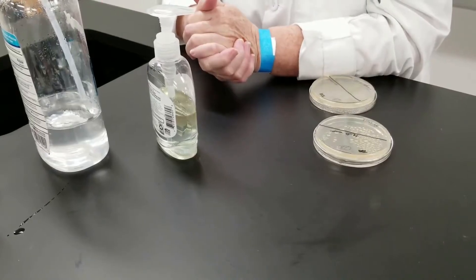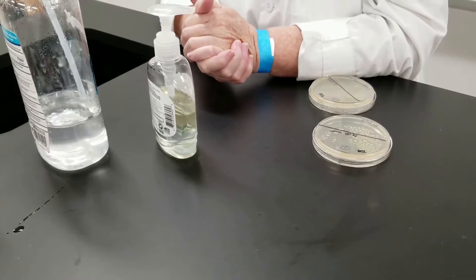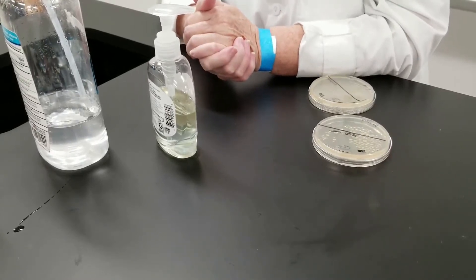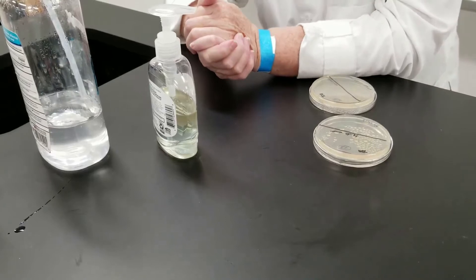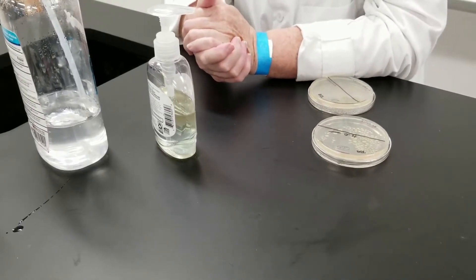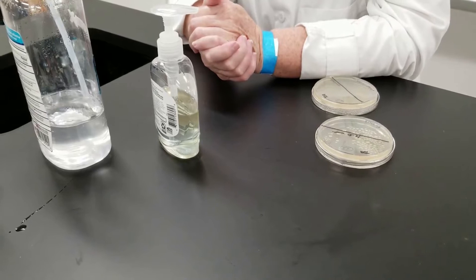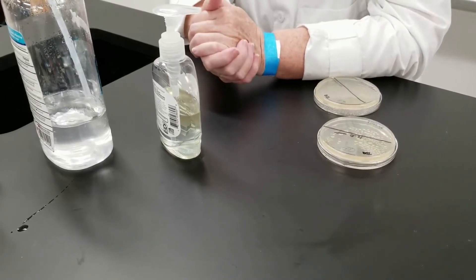We're going to look at the effects of hand washing, or not washing your hands. We're going to test different ways: without washing, with just rinsing with water, with washing with soap, and then using hand sanitizer.